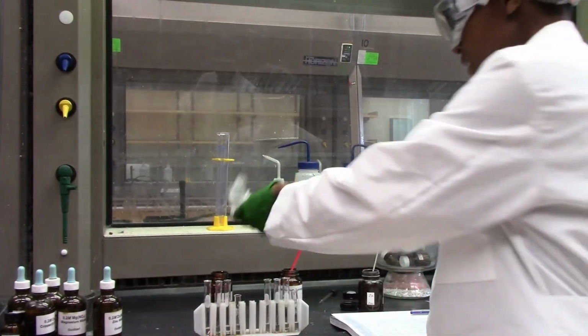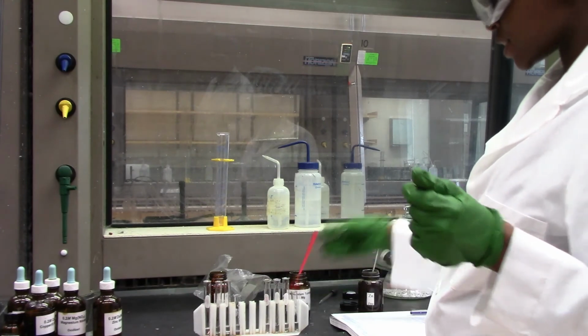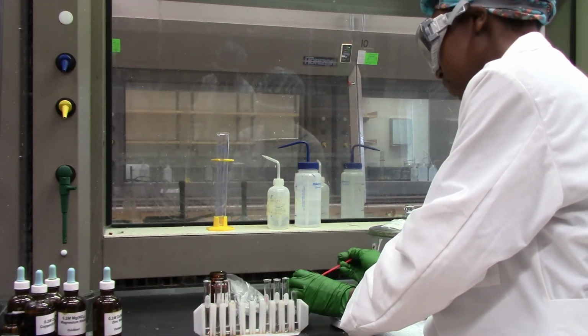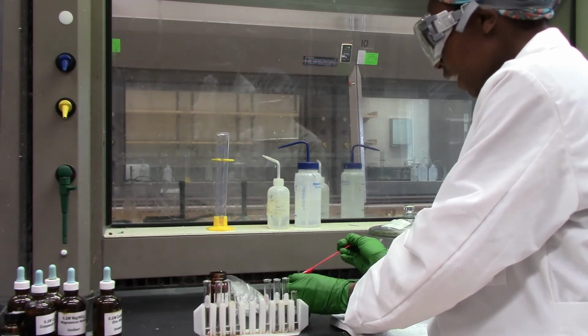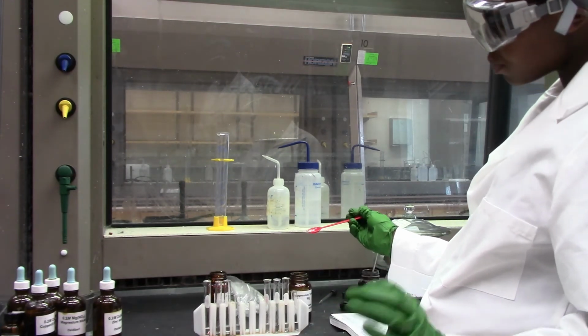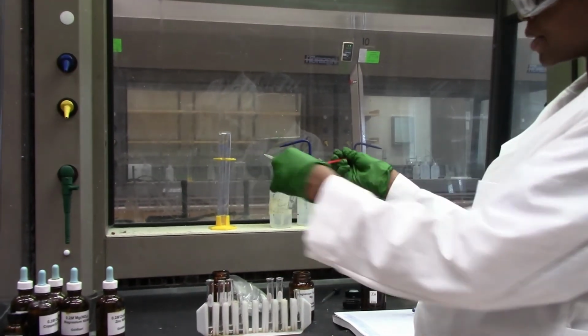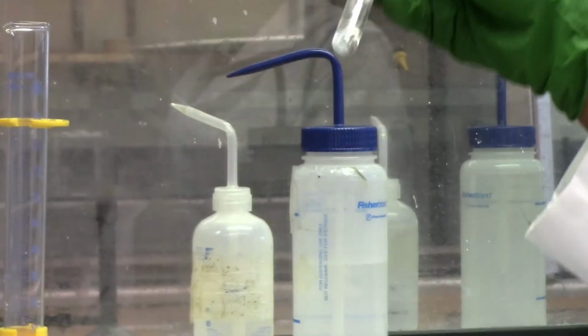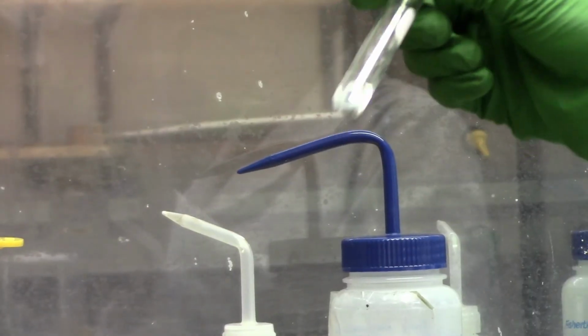Great. Now let's go to magnesium versus zinc. Okay, I kind of have a prediction of what's going to be more reactive, but let's put in the magnesium and see what happens. Okay, well, I guess no reaction.